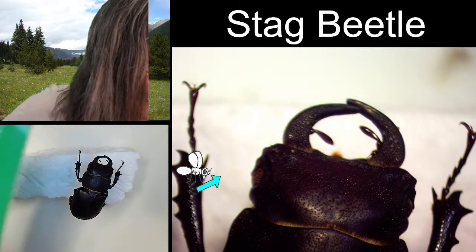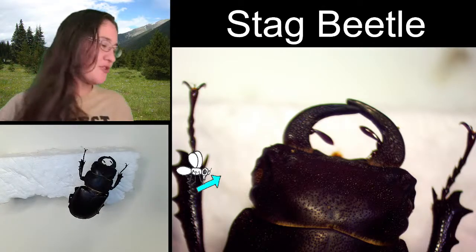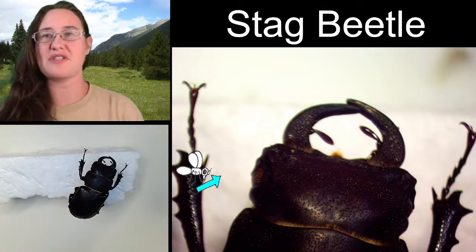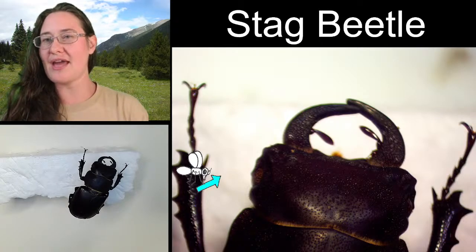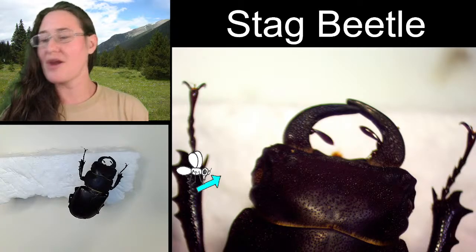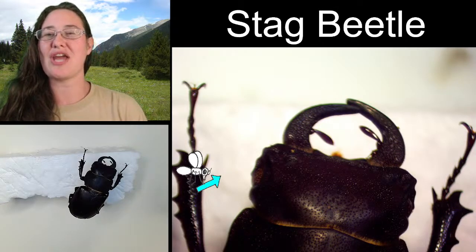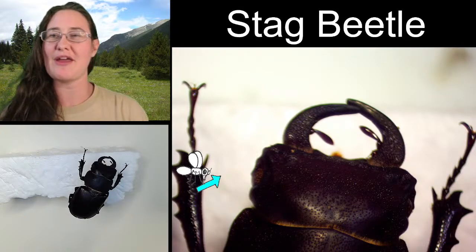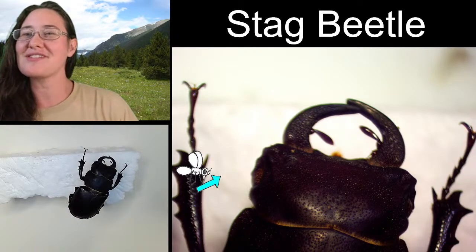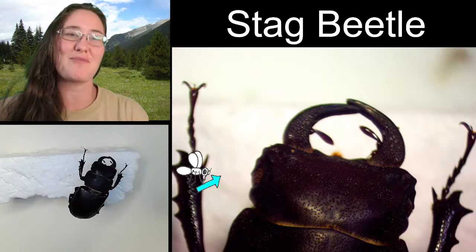That's the inches side. Yeah, either 3.1 or 3.2 centimeters for the length of the specimen. I'm going to write 3.15 centimeters long in the chat so that if somebody else was curious they'll be able to find that information. I recently learned that I can pin that message so that everyone sees it at the top, which is fantastic.